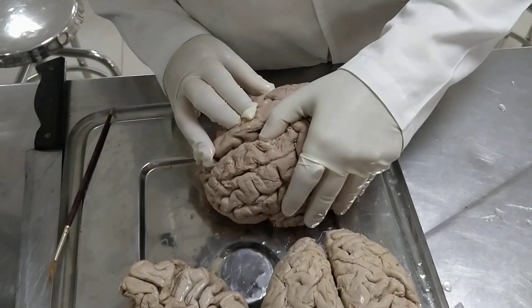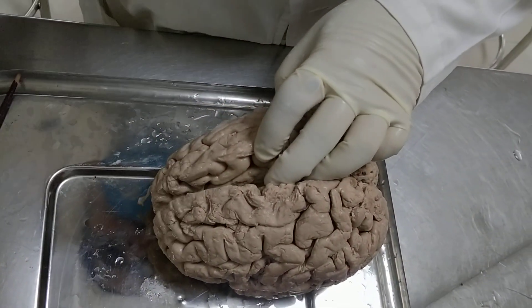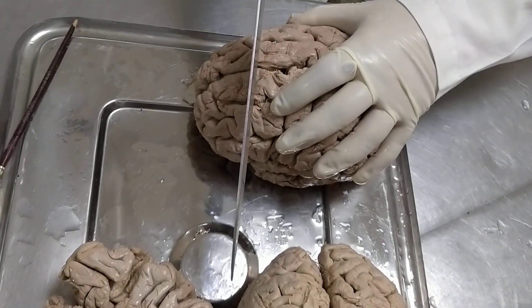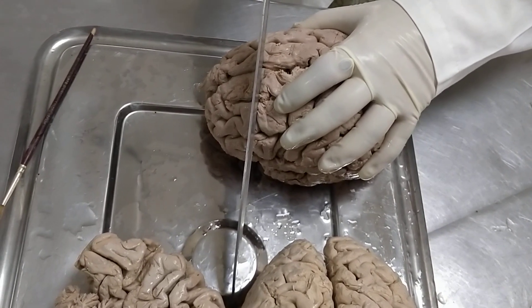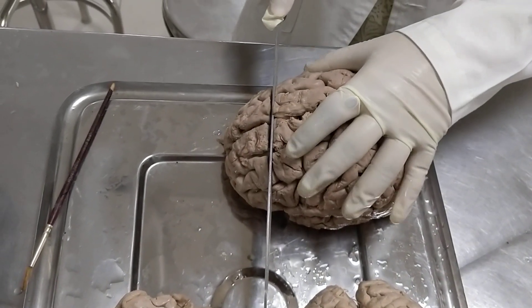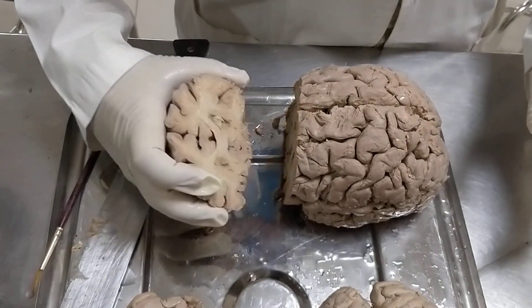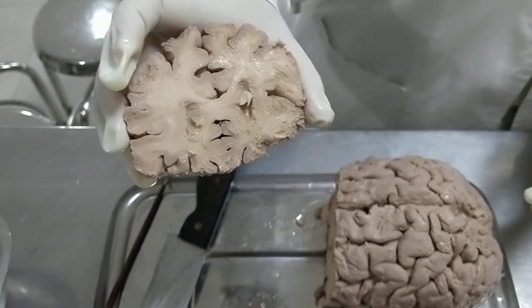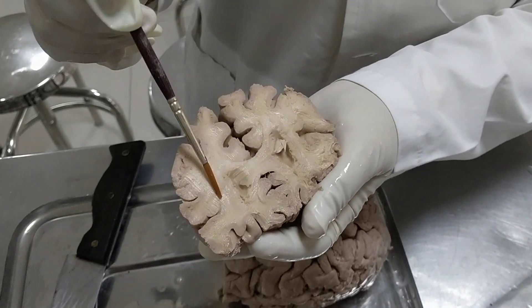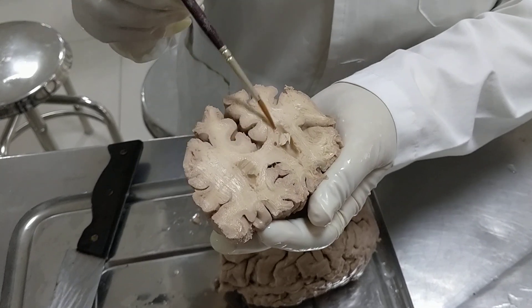Let me see the position of the corpus callosum. The corpus callosum is visible here, and this is the anterior end of the corpus callosum. So I am cutting this section at this level. When you cut a section of the brain, you have to pass your knife with a little pressure and there is no backward movement. This is the first section of the brain, which is at the anterior level. What you see here — this bridge — this is the corpus callosum, the genu of the corpus callosum, which is connecting the frontal lobes of the two sides. From here, the fibres arise which we call the forceps minor, which go upwards to connect these areas.